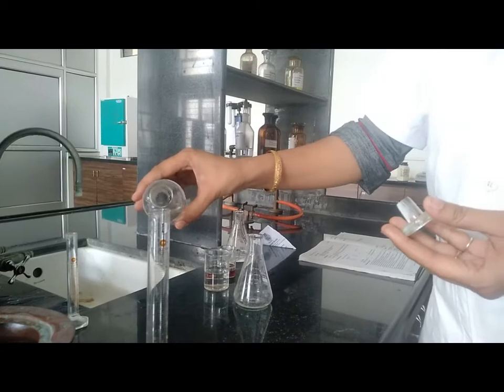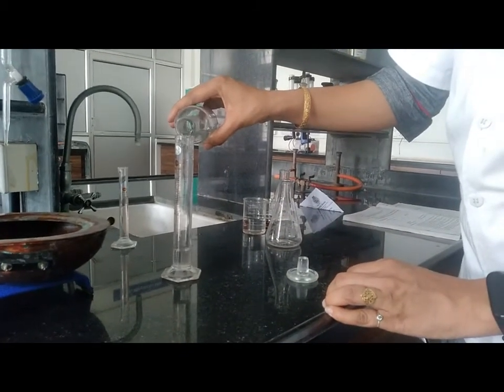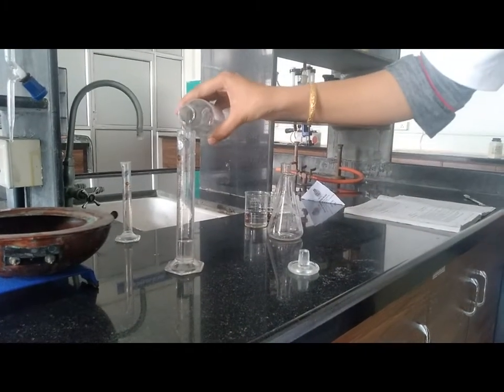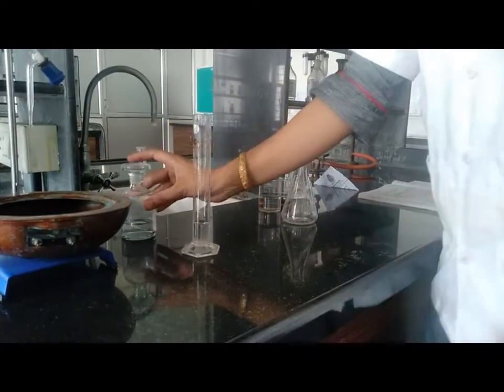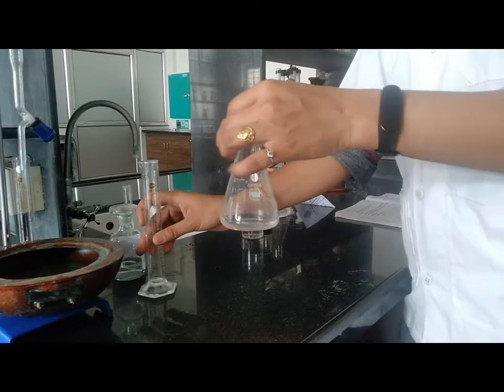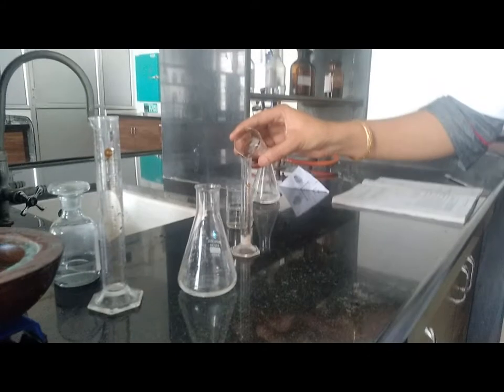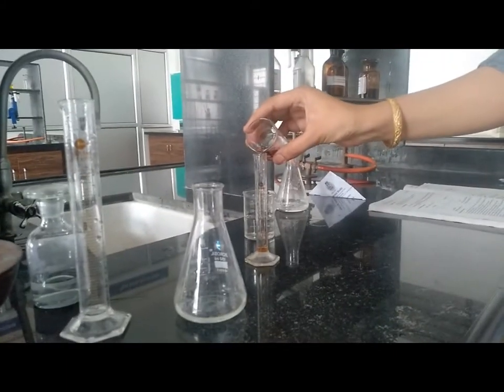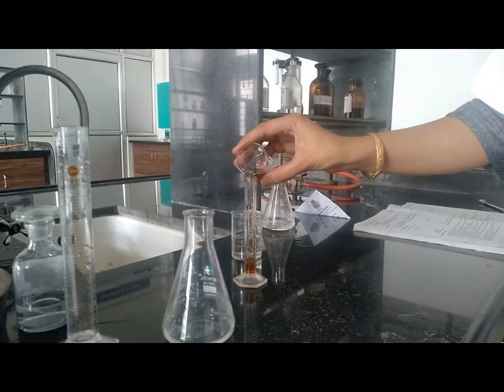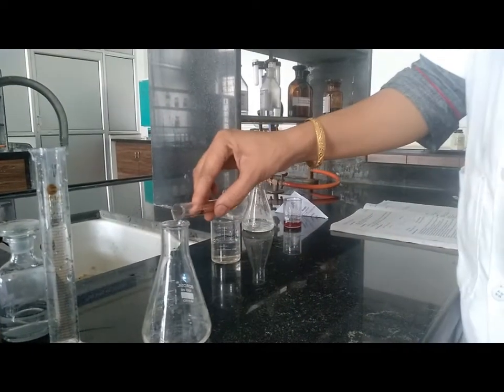Then take another conical flask and take 12.5 ml of glacial acetic acid. Put this 12.5 ml of glacial acetic acid into the second conical flask and add 8.5 grams or 2.65 ml of bromine. Add it to the second conical flask.